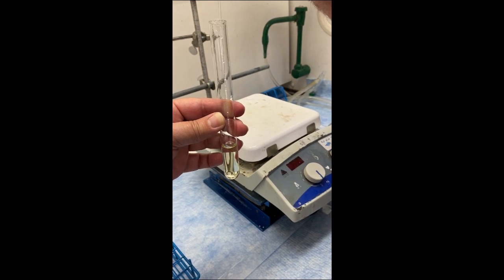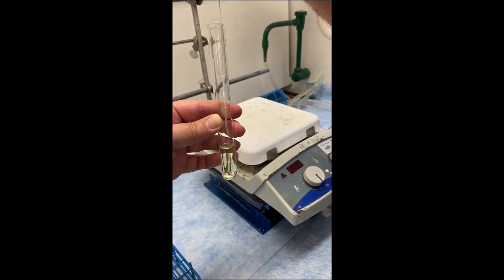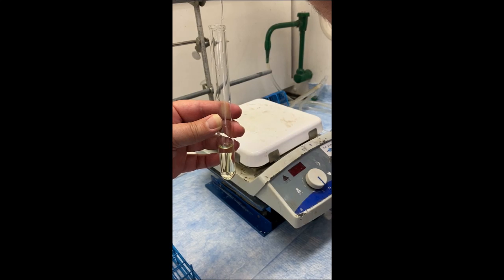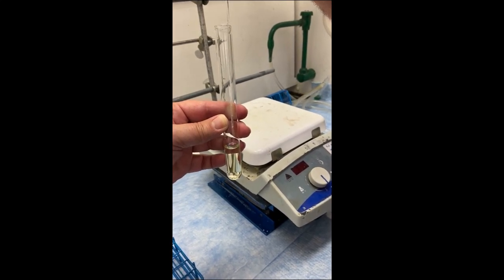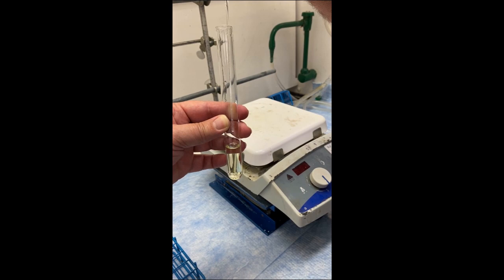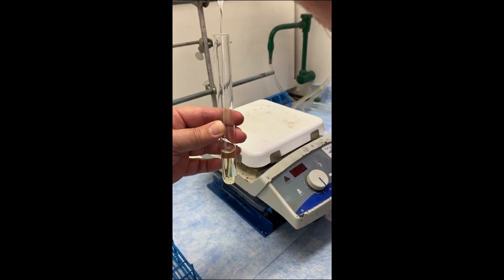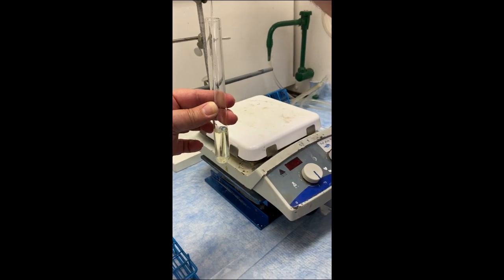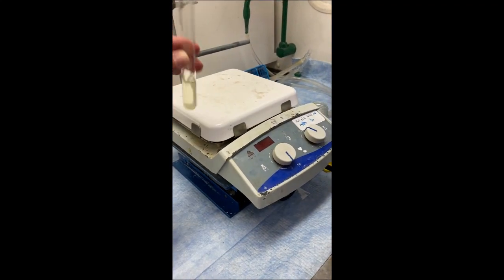And once we do that, we're going to see nucleophilic attack of the benzaldehyde. This is a remarkable lab in that you can visualize the formation of product as the yellow starts to appear and you start to see conjugation.